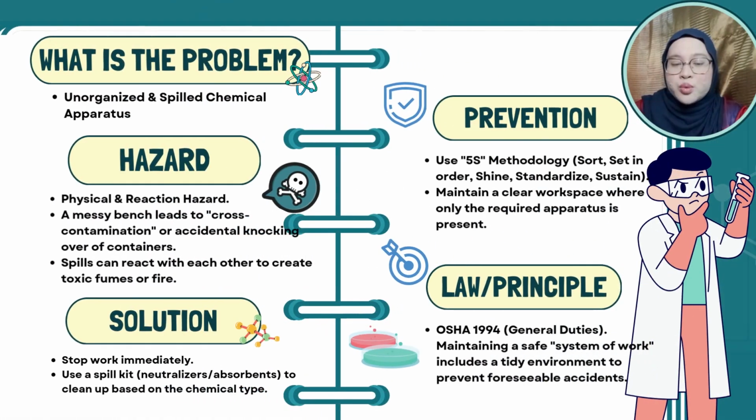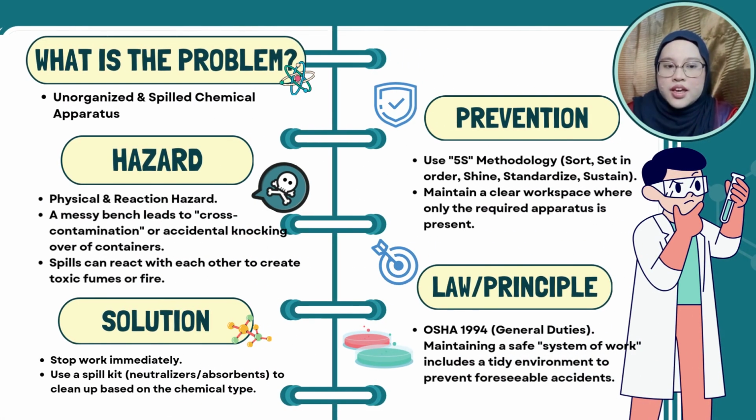So, what is the problem in the video? The hazards are, first, physical and reaction hazards. Second, a messy bench that leads to cross-contamination or accidental knocking over of the containers. And lastly, spills can react with each other to create toxic fumes or fire, which is dangerous in the laboratory.